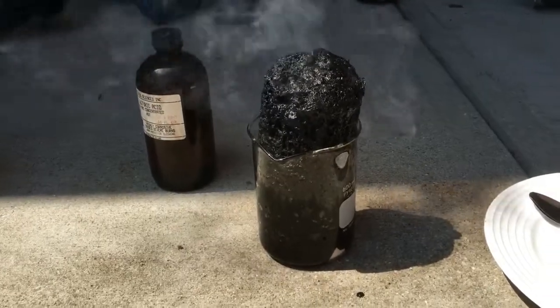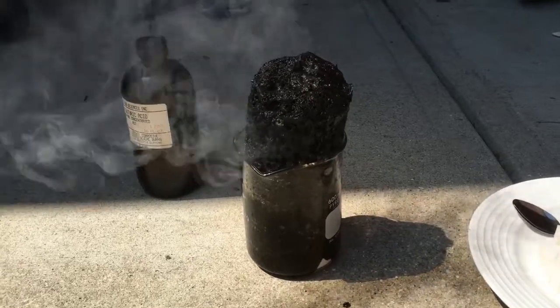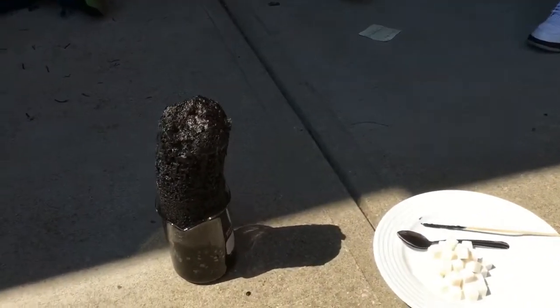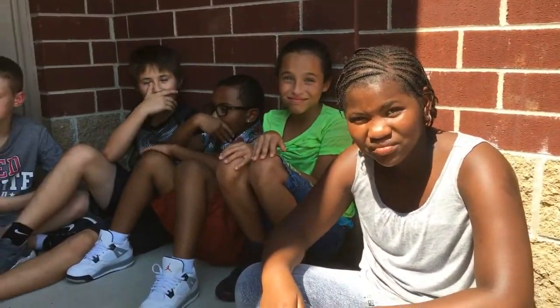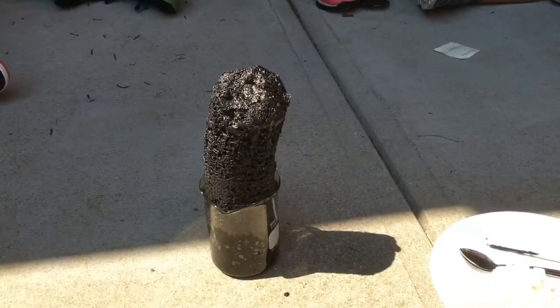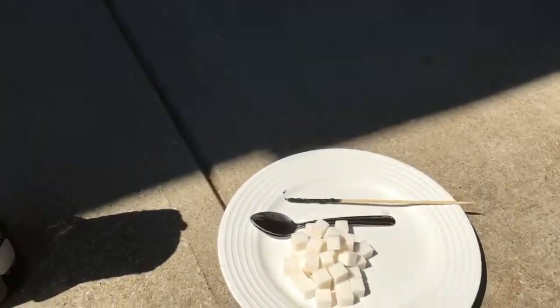Now we have another version of this same experiment. This version is with sugar cubes instead of granulated sugar. Look. Now class, as we can see the amount of carbon that has risen out of the beaker, we're going to attempt the same experiment, but this time we're going to use just sugar cubes, and we're not going to mix the sulfuric acid with the sugar. We're just going to let it stand, and see if the carbon spreads out, if it has the same kind of surface area when we don't stir the acid with the sugar cubes.